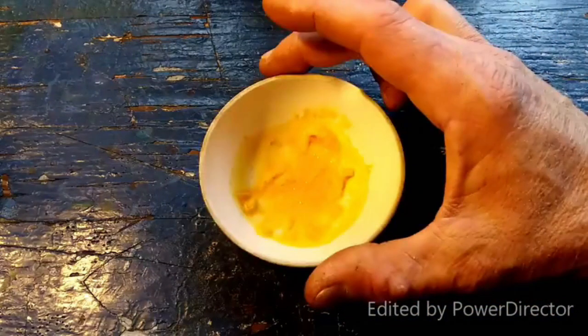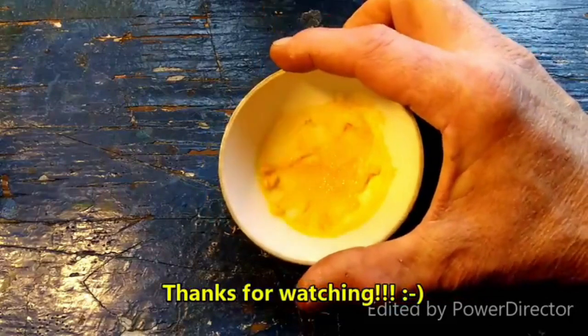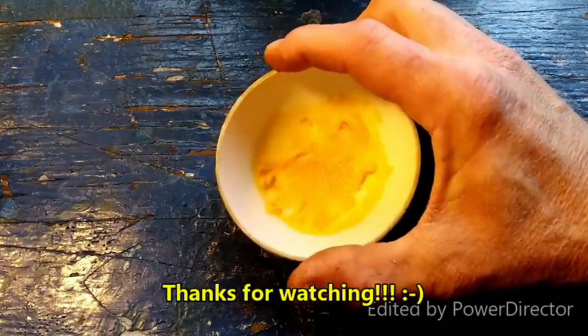Damn, that is beautiful. Look at that. Gorgeous. I love it when it sparkles.